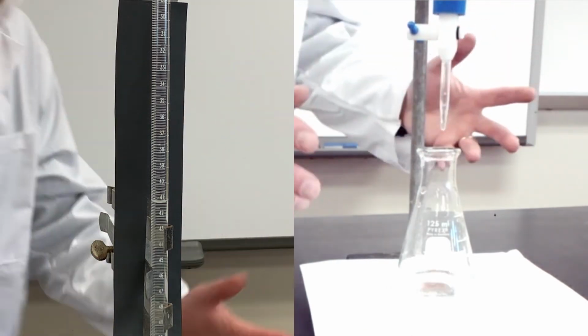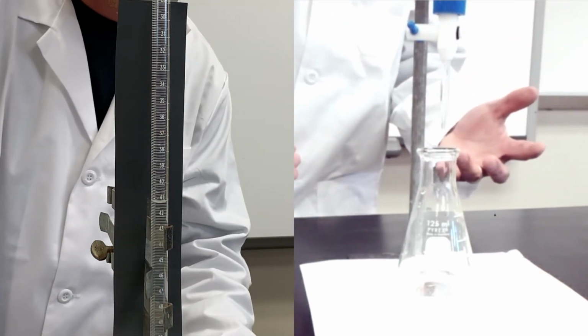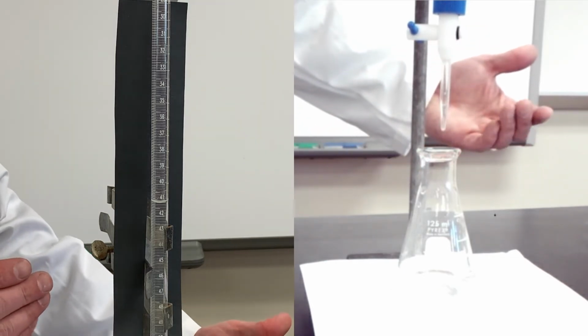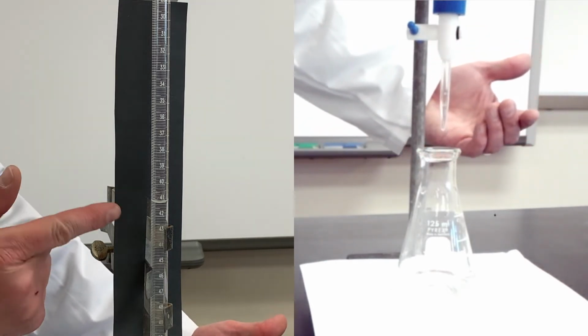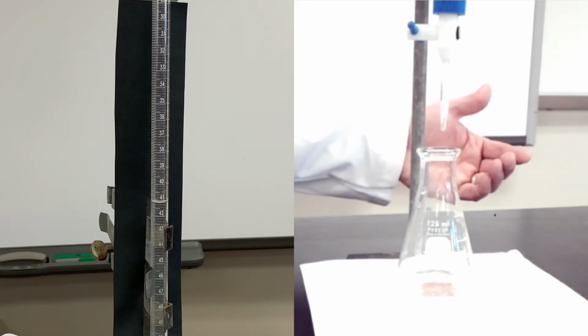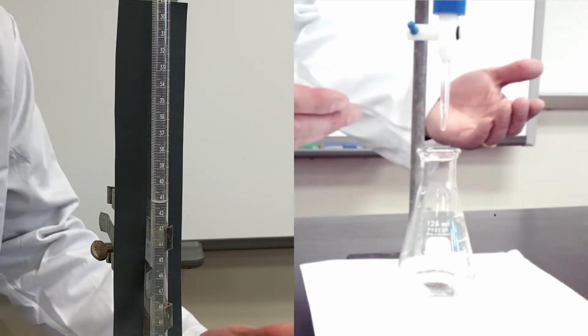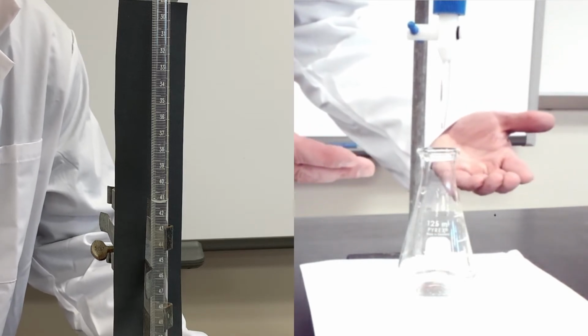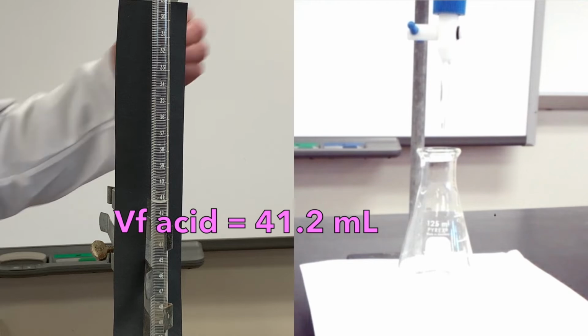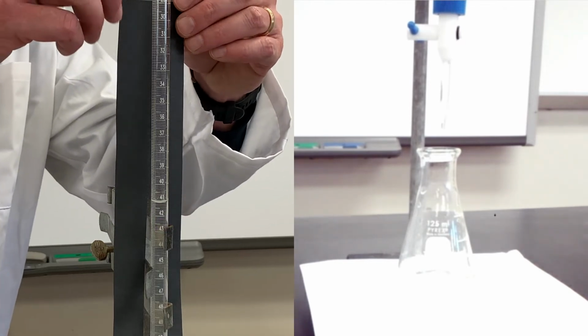And we're just gonna get a little crazy, right? I guess as crazy as you can get with titrations. Instead of trying to do exactly 15 milliliters, I stopped at 41.2 there, okay? So that's gonna be our final volume for our acid, 41.2. You're gonna wanna make sure that you notate that on your lab sheet.